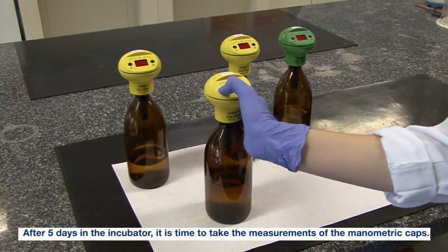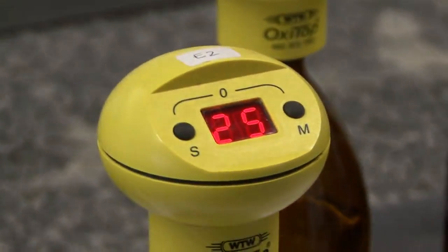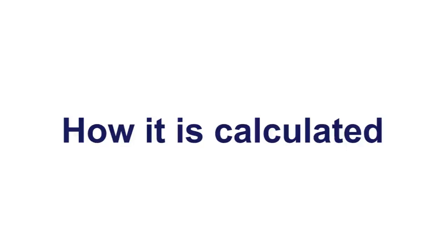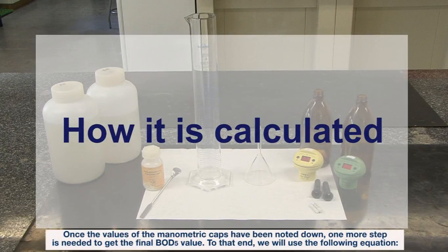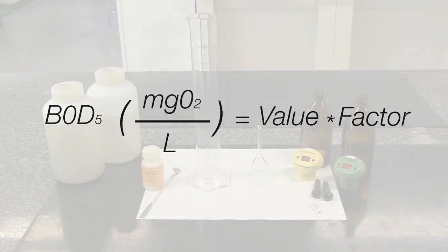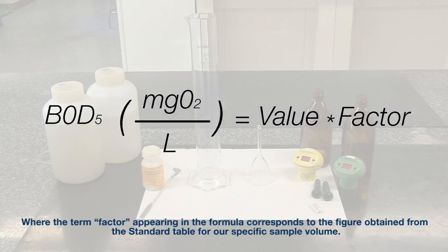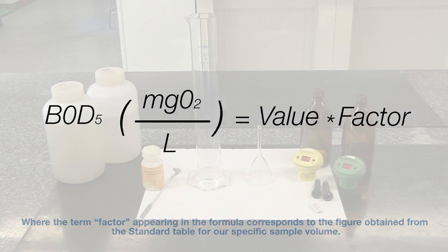After five days in the incubator, it is time to take the measurements of the manometric caps. If the value is out of range, no value will be displayed. Once the values of the manometric caps have been noted down, one more step is needed to get the final BOD5 value. To that end, we will use the following equation, where the term factor appearing in the formula corresponds to the figure obtained from the standard table for our specific sample volume.